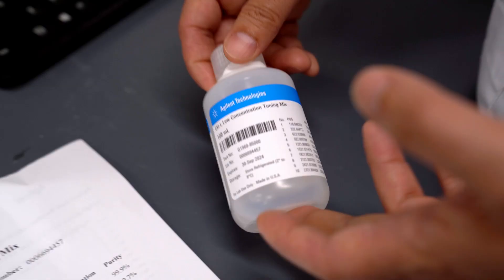This unit behind me here is an Agilent 6460 triple quad mass spec. This is how you tune it.